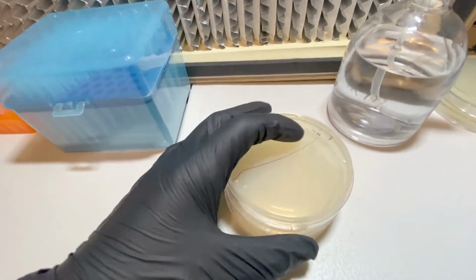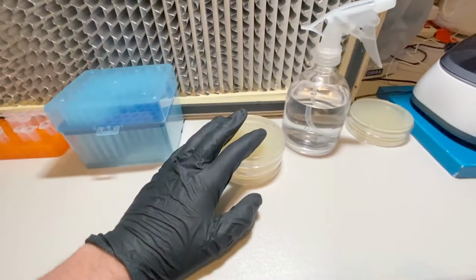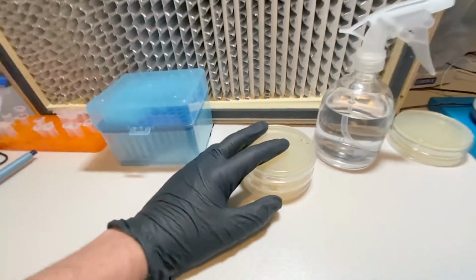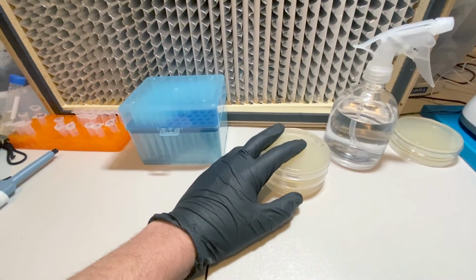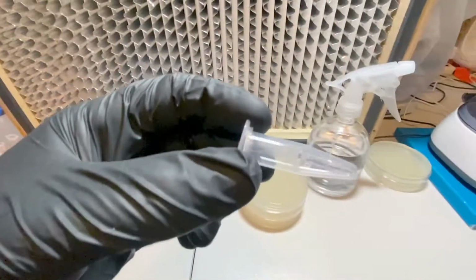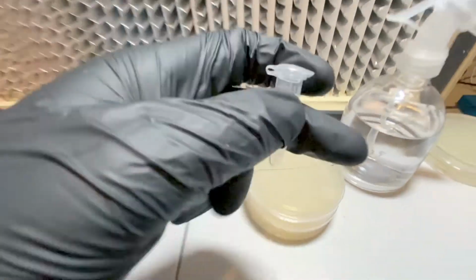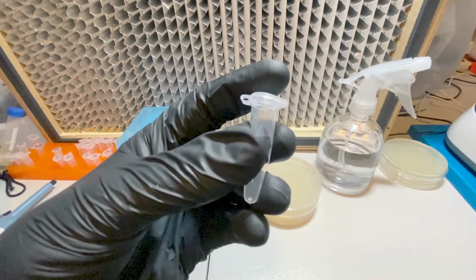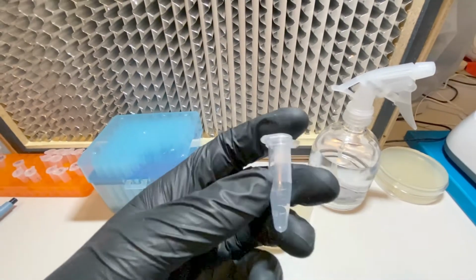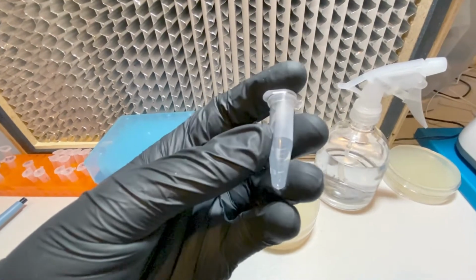They're just the E. coli recovering. And so I was thinking, how can I determine whether the colonies I do see around the edges have actually been successfully transformed? One way is I can take a tube, put some LB broth in there, put some kanamycin in there, and then pick the colony off and put it in the tube. If I see growth in the tube, that means it was transformed, because only the transformed colonies will have the plasmid with kanamycin resistance in it.